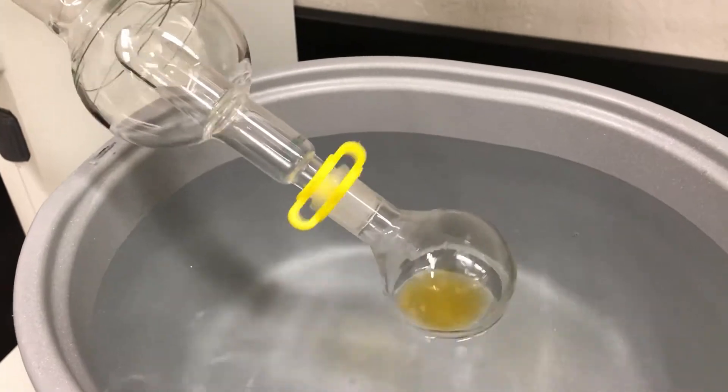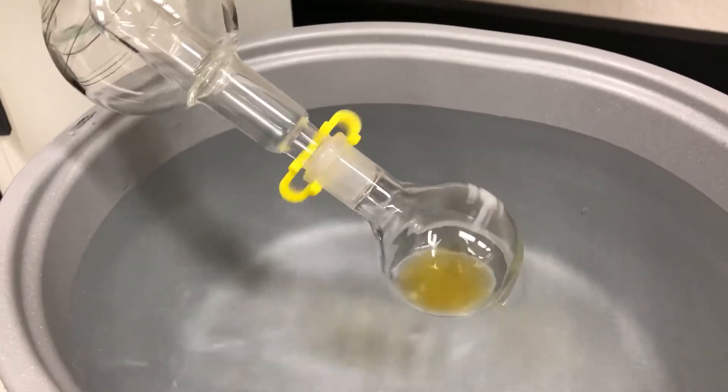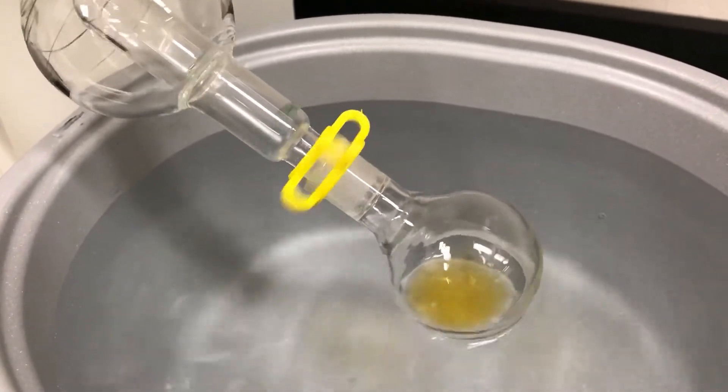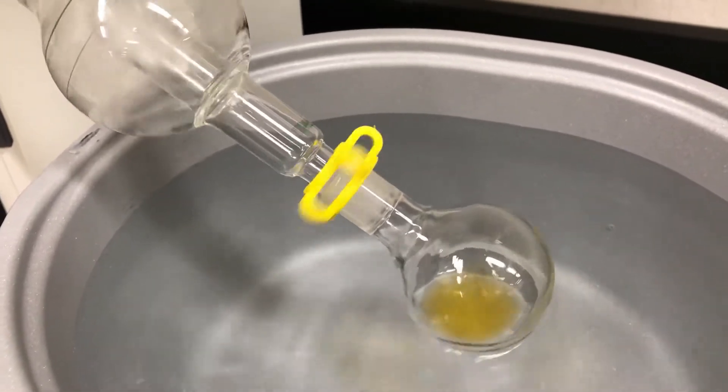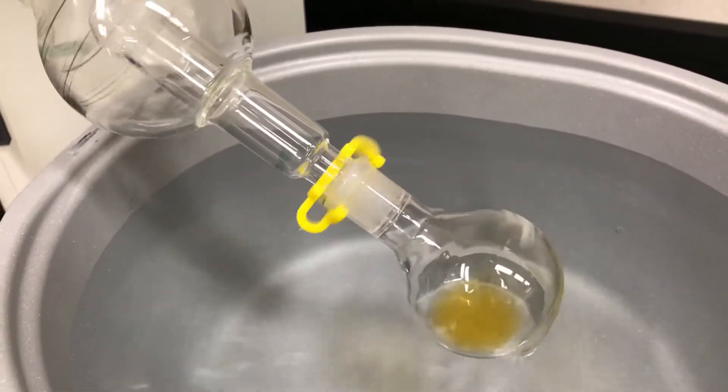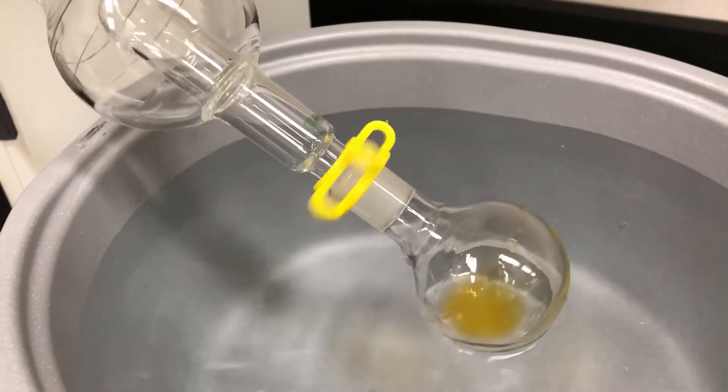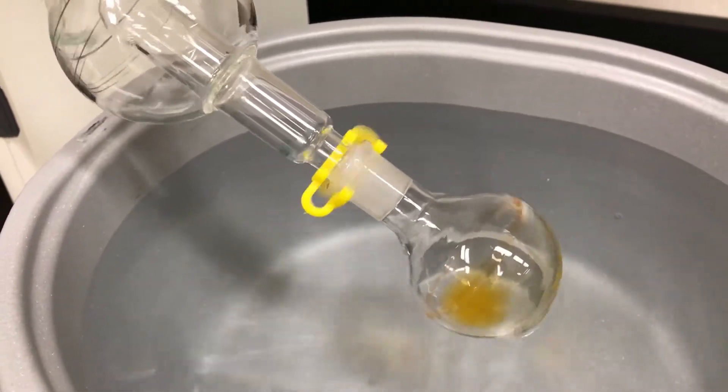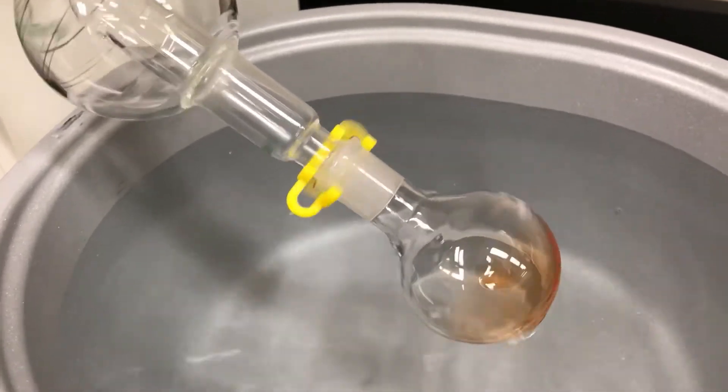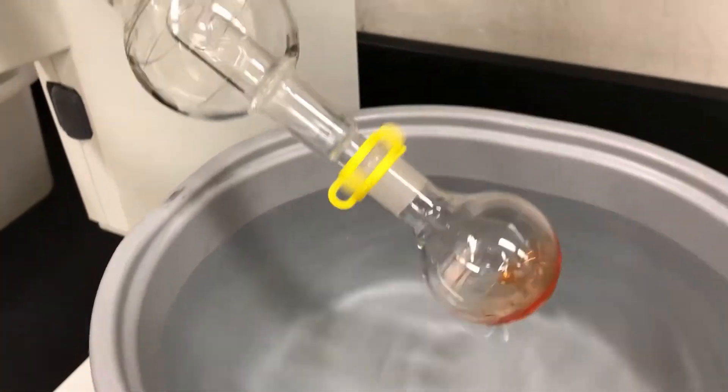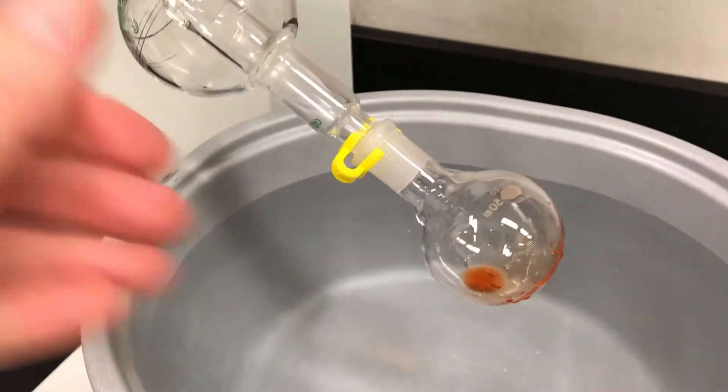Here's what it might look like if you were expecting a liquid. It's much less dramatic. The solvent level just drops and gets lower and lower and eventually it looks like it's not changing anymore. And sometimes it's even really hard to tell that there's any liquid left at all. It might look completely empty and you might not know that there's any liquid left over until you stop rotating and at that point it then pools down to the bottom.